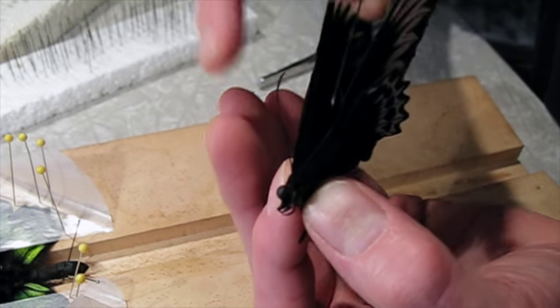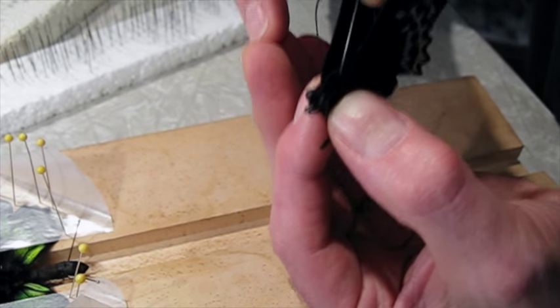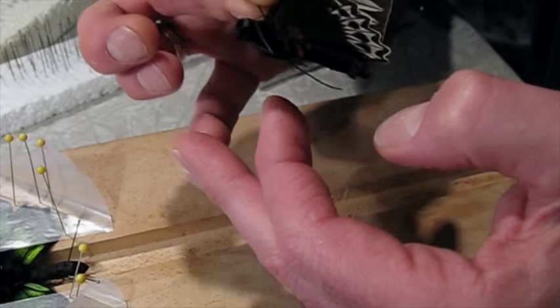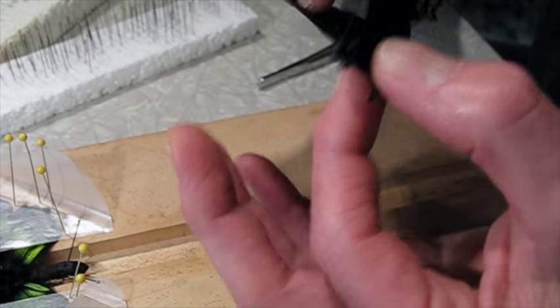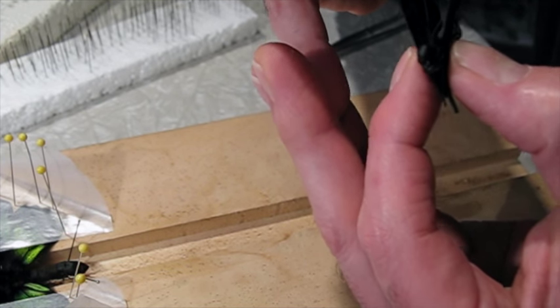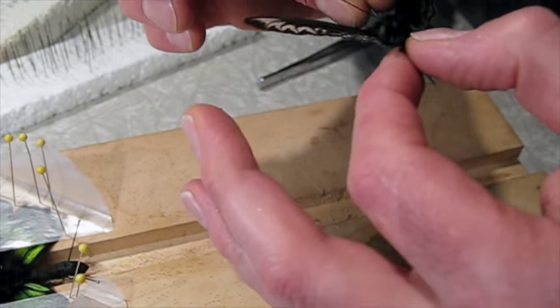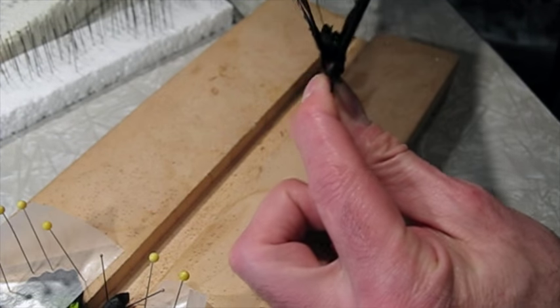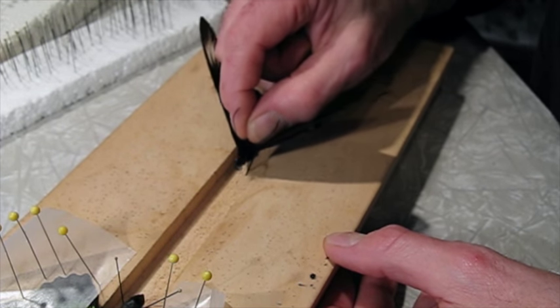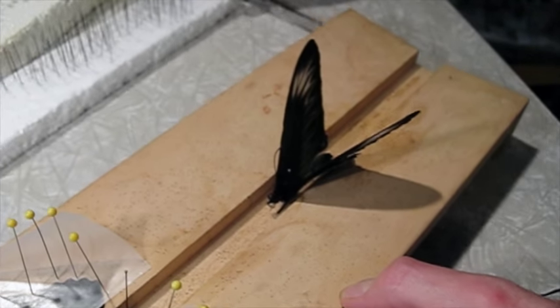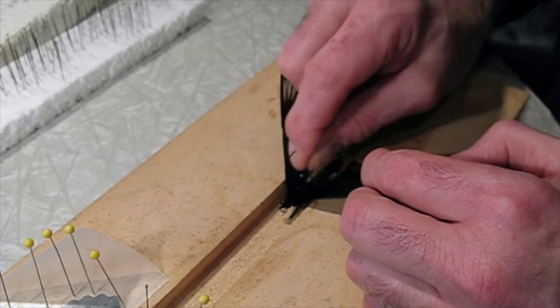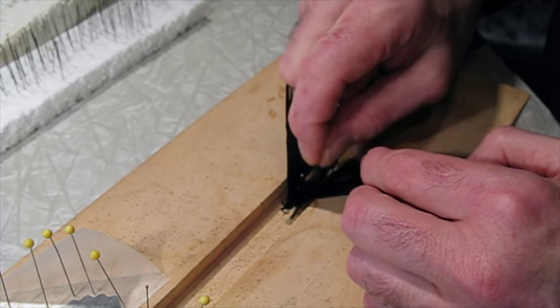Straight down through coming up between the legs. That looks good. Well, that's a little bit tilted too far, let me straighten that out. I can't emphasize enough how important it is to make sure everything's straight, to get the pin in straight and to get the butterfly or moth aligned properly on the spreading board. Otherwise it just makes everything a lot more difficult. And bracing the abdomen. Get that nice and straight.